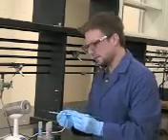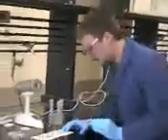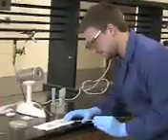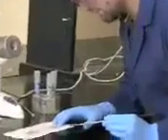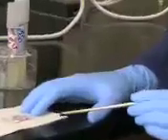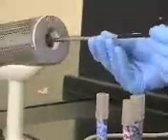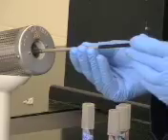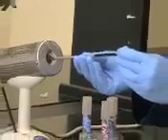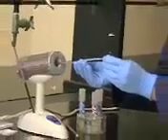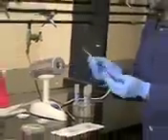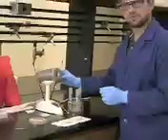Now you're going to take your loop and gently rub it right inside of the red circle that you made on your slide. Take the loop, sterilize it again for 15 seconds, and place it back next to the Bunsen burner.